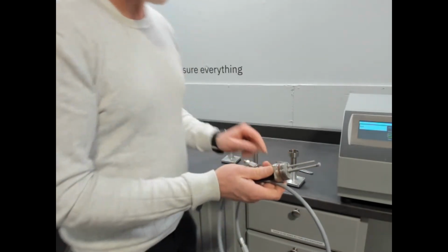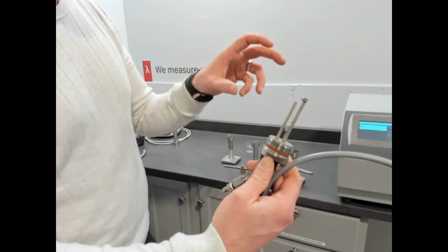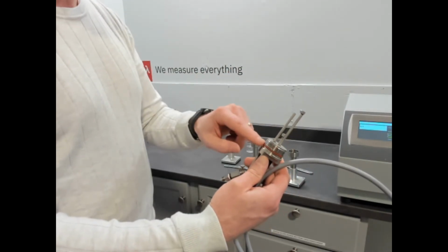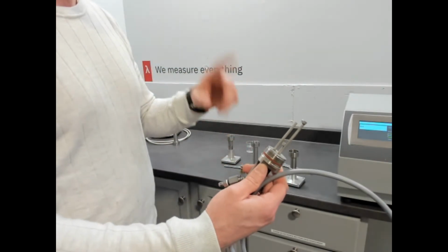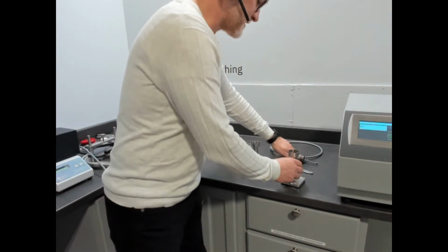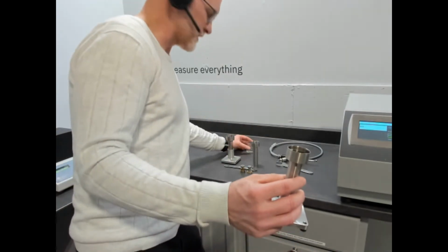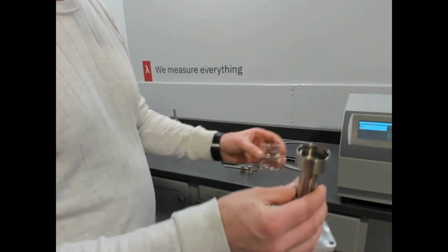The reason why there's a little bit of tension is because there's an O-ring. That O-ring is what we use to seal the cell so that we can apply back pressure if needed. And those O-rings come in different types to go to cryogenic and up to 200 or 300 C depending on your test cell. So when we load our cell, which holds around 20 milliliters of fluid, we typically fill it to the ridge there, you can see.